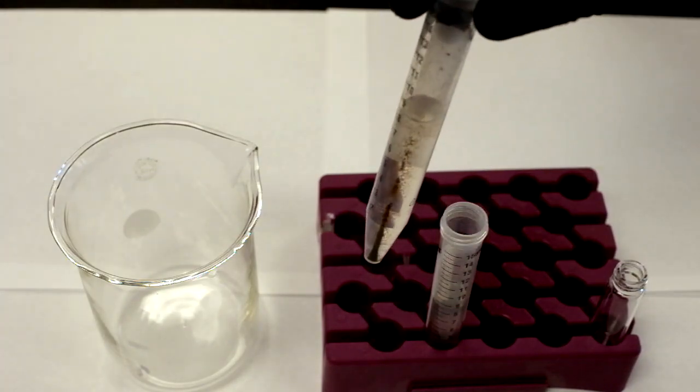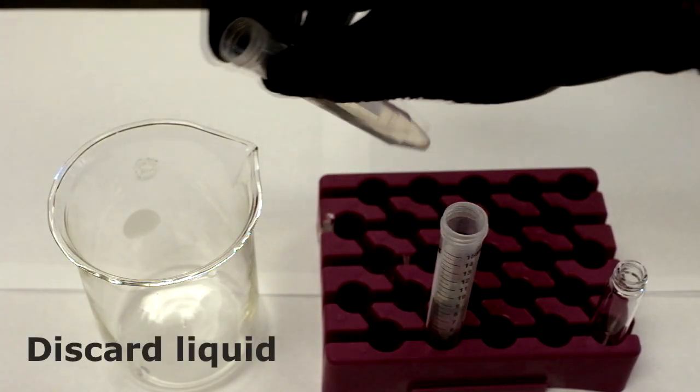After centrifuging, we can see that the particles have collected to one side and we can pour off the liquid phase.